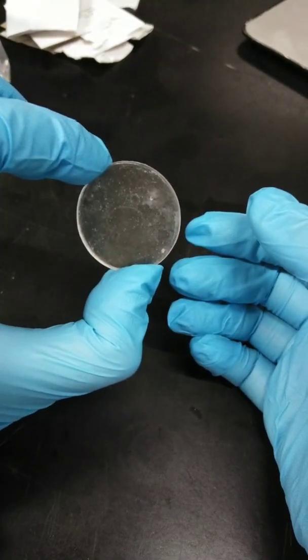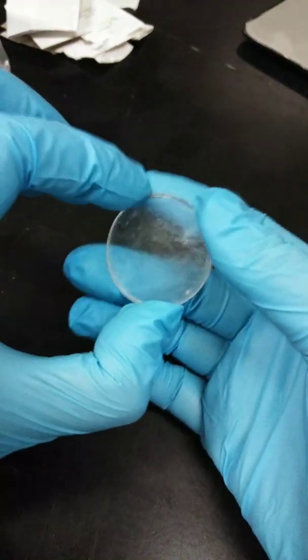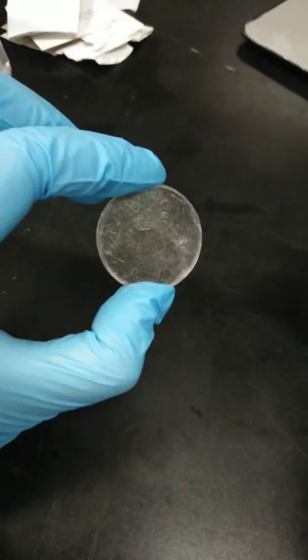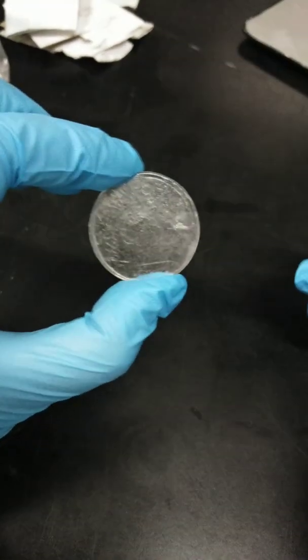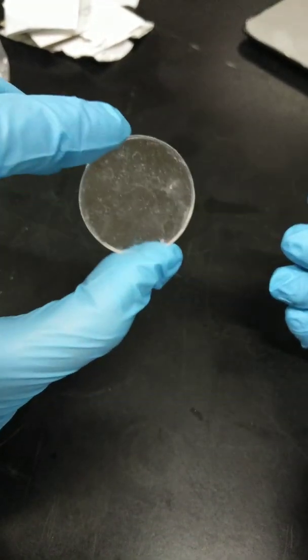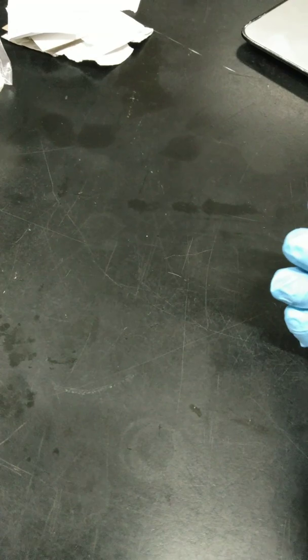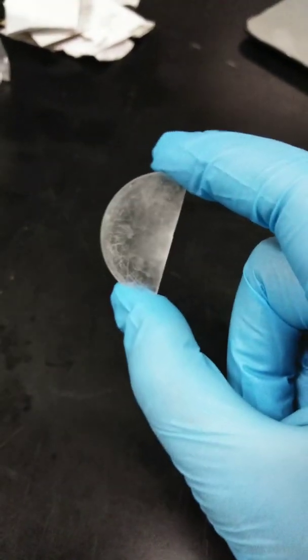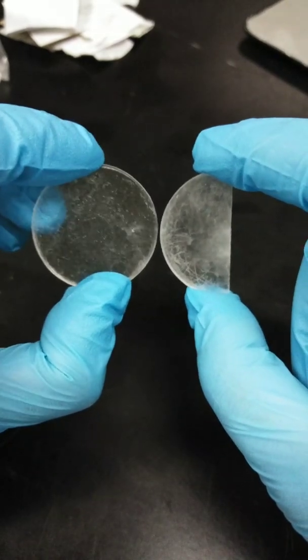So this is another form of the plate, but it's a little bit cloudy. So it's not a good plate to use, but the thing is, we don't have new KBr plates, so we are going to use this.